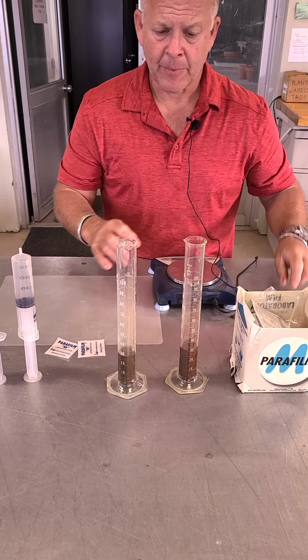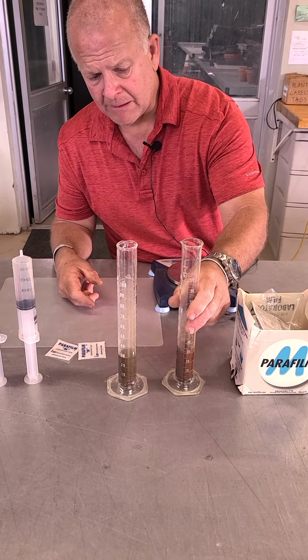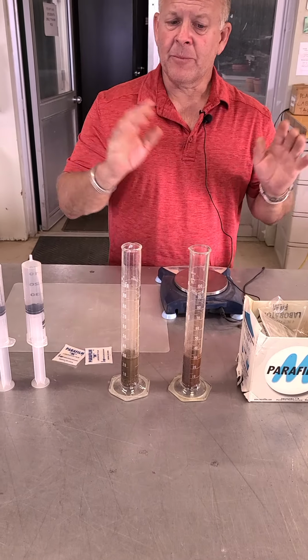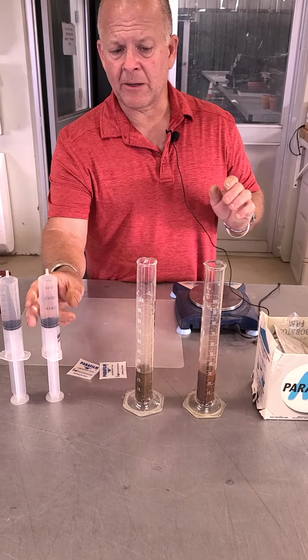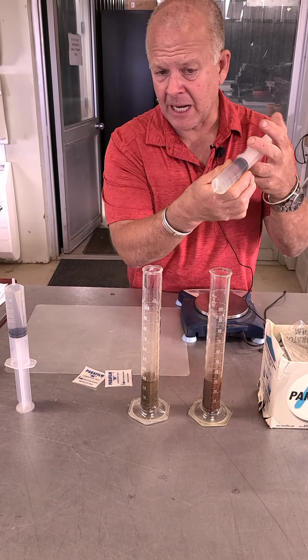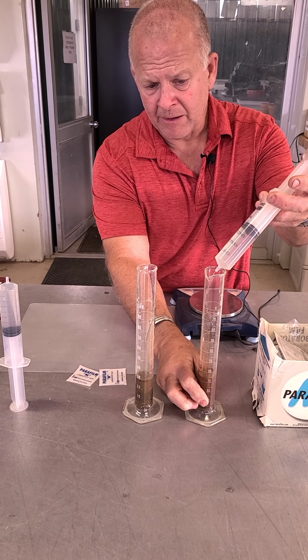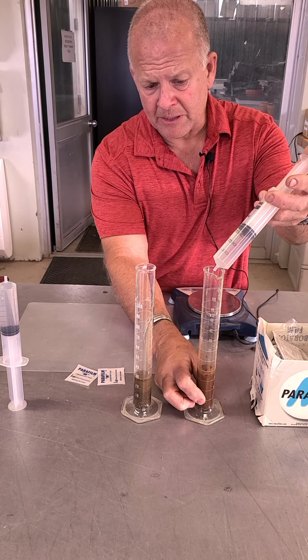Right, now I'm just going to tap these right now. Just get them down there, but you can see that there's some of my soil that's stuck here on the side. So I'm going to carefully use this, and I can use all of it, it doesn't really matter. I'm just going to go around the side here, and if I'm really good, I can stop at, say, 20.